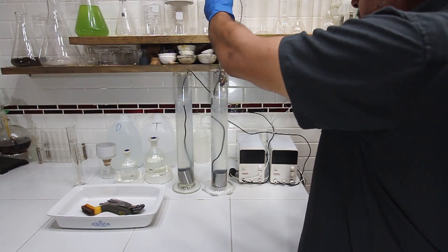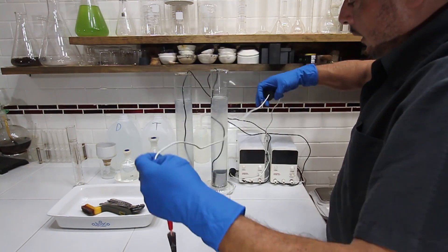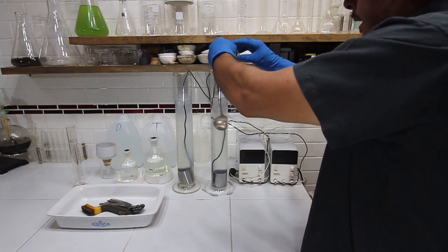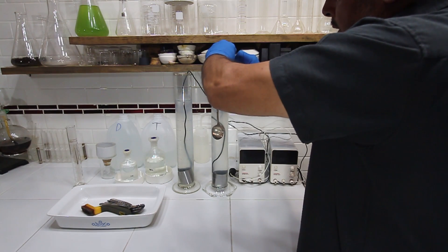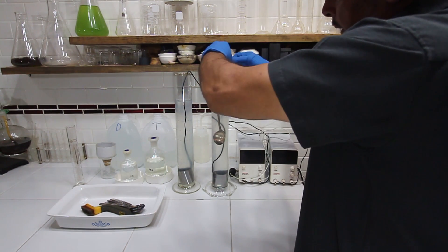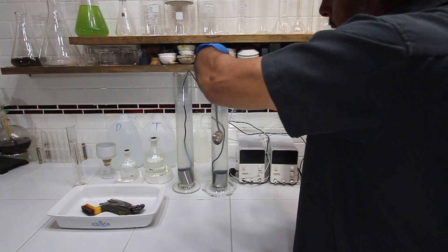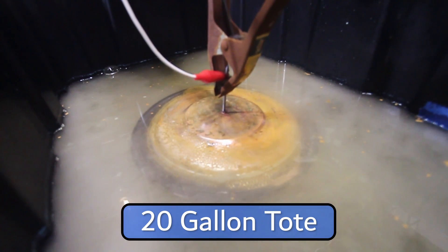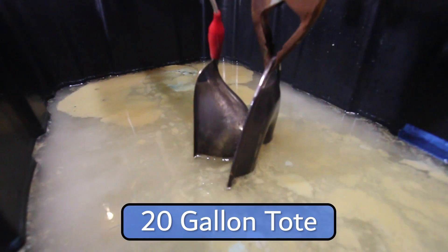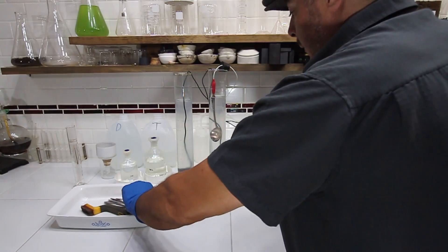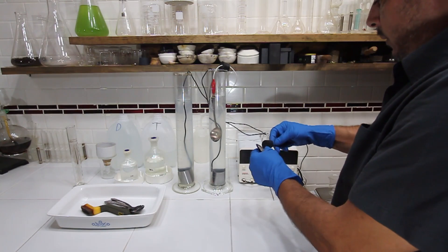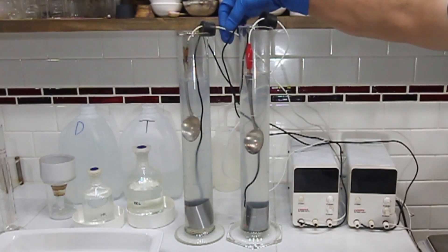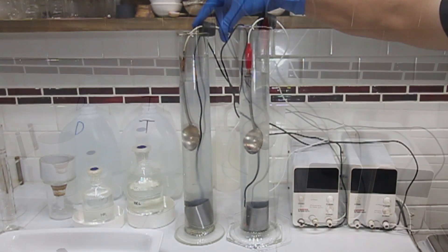Typically I'll just slide this up to my first hand, lower that in. Now the only reason I'm using these graduated cylinders is just because it's the best way to see this experiment. You could use a five-gallon bucket, a regular standard beaker—you can use anything that'll contain a little bit of hydrochloric acid. So I'll get the second cylinder set up. You can just use that hole there to raise and lower, and it'll stay put.